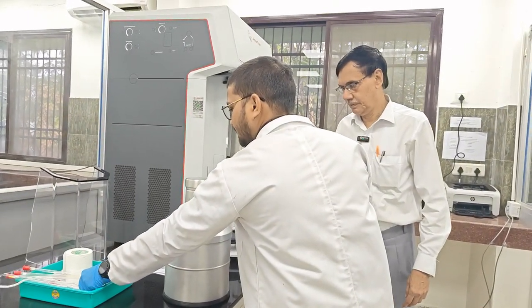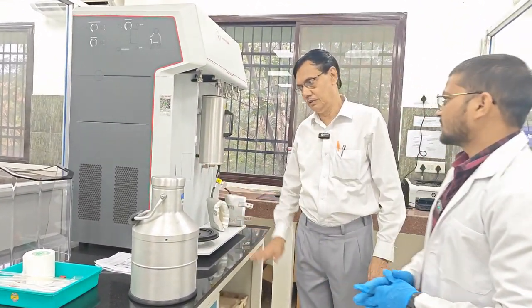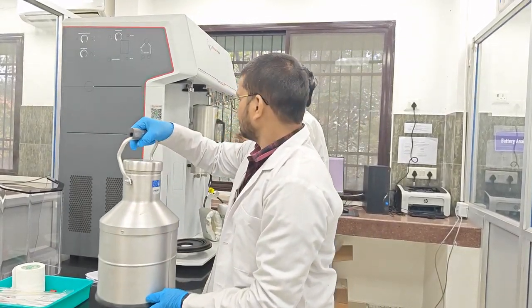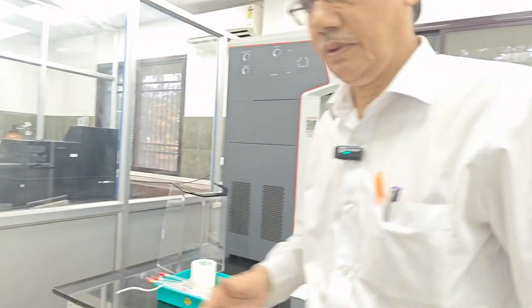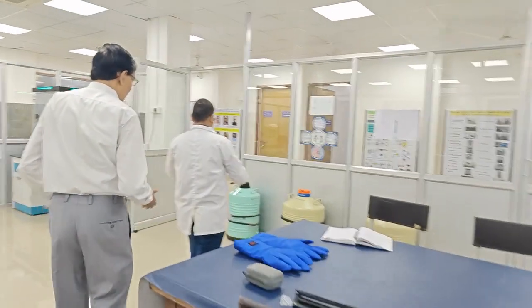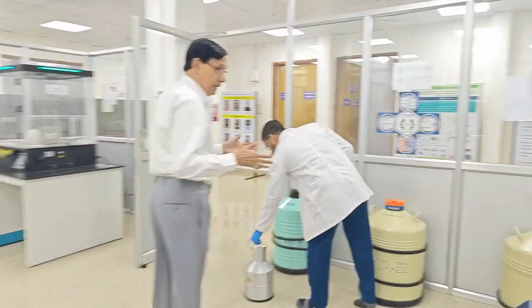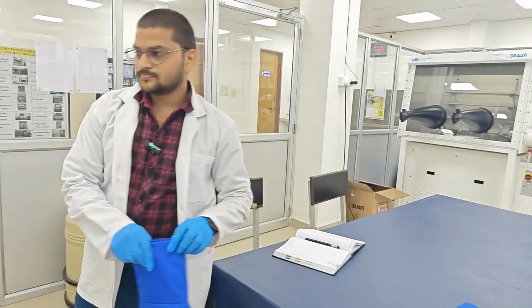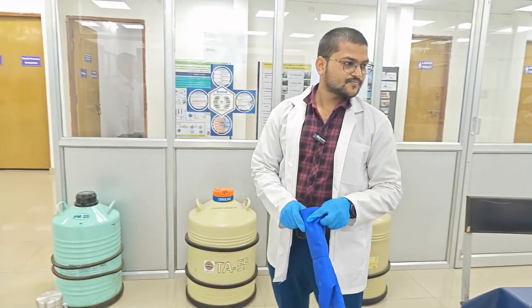Okay, the weighing part is over. So here we will check this. You know that for liquid nitrogen handling, we should take some precautions, so therefore we are using that thing.